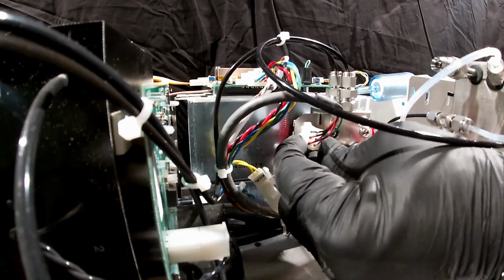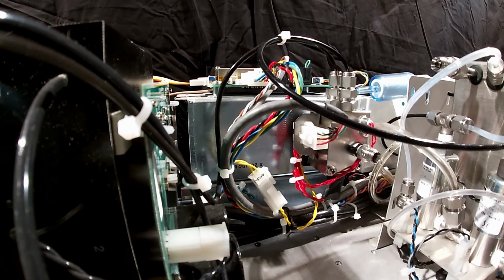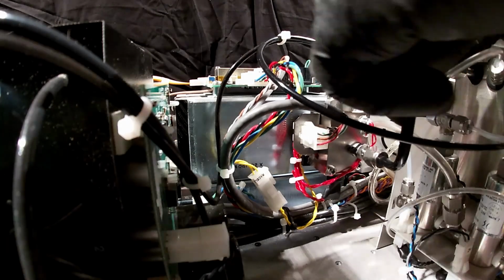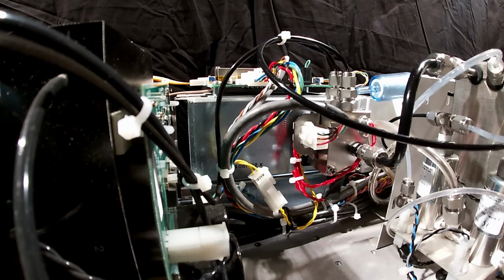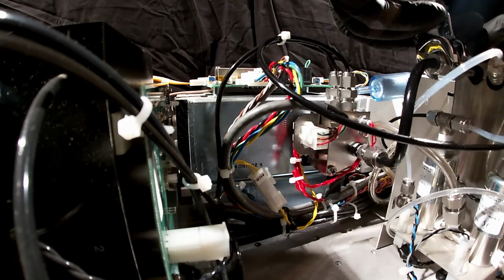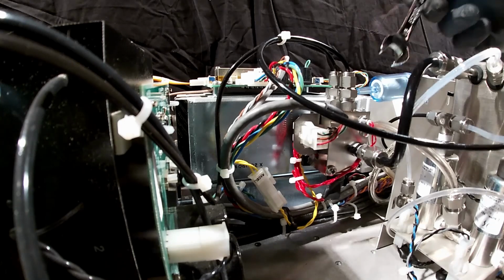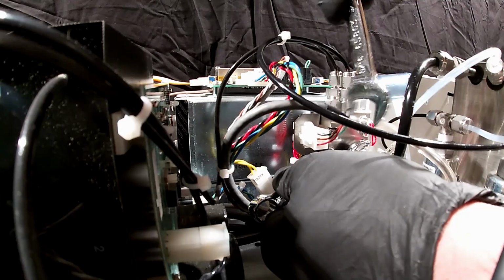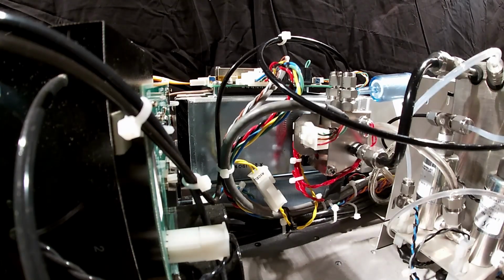We'll plug our harness back in here, and our exhaust tubing here. These union fittings, just remember, always use 2 wrenches so you're backing up this fitting. Don't just try to turn on this and put all the force through there. So we're going to use that 1/2" wrench on the union. And that one, same thing down here. One of these is a pipe thread into the reaction chamber, but we don't need to stress that and tighten it anymore. It's plenty tight, so make sure and back those fittings up. Close our alcohol so it doesn't evaporate away, and that's it.